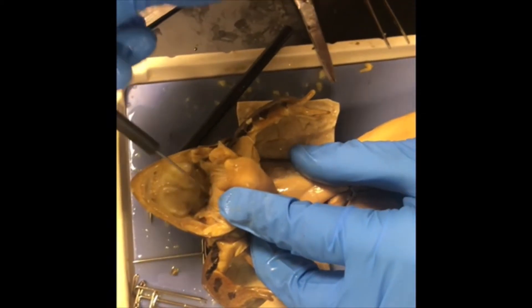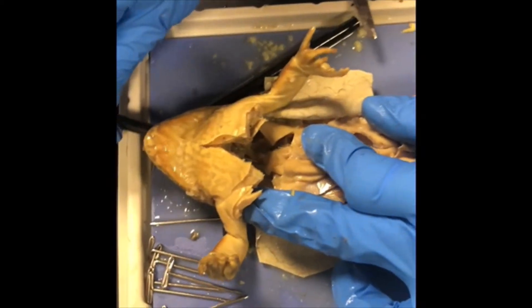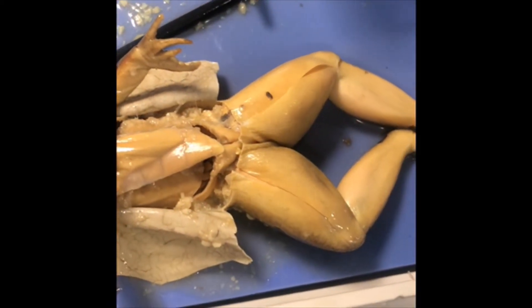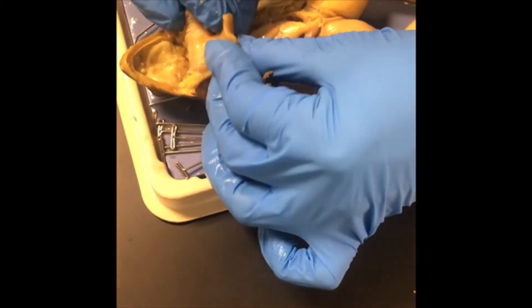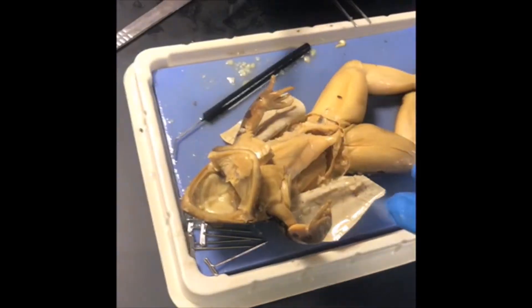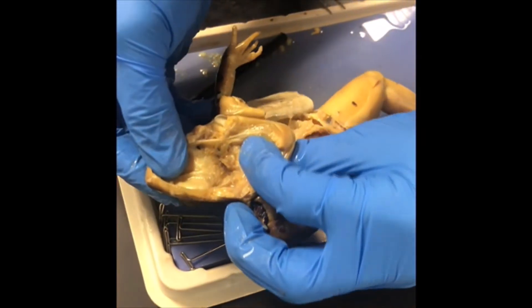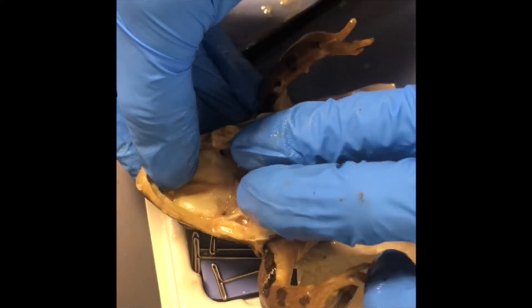The probe goes down through — you can see it coming through, so the trachea is right here. We've removed the esophagus going down into the stomach. Identify the tongue attached to the lower jaw's anterior front end. Use your scissors to remove the tongue and put it on the placemat. The Eustachian tube openings are at the angle of the jaws — the tubes lead to the ears and equalize air pressure. There are the little holes — the Eustachian tubes.